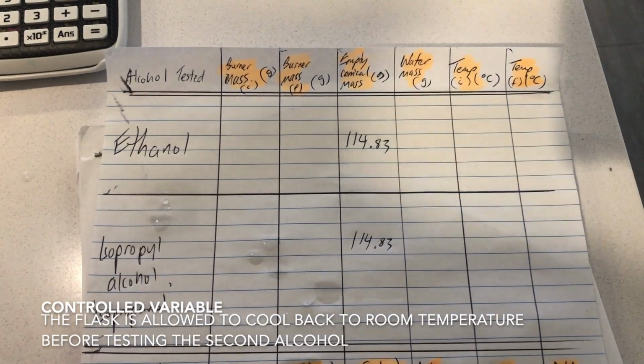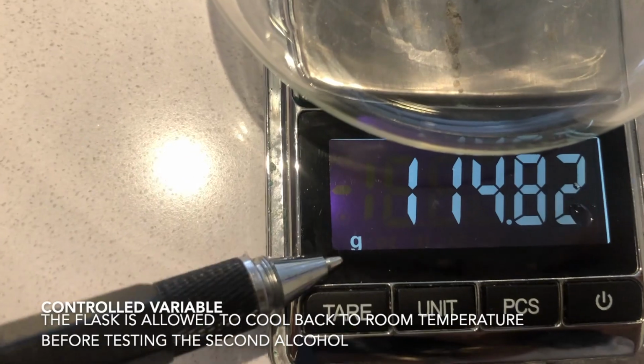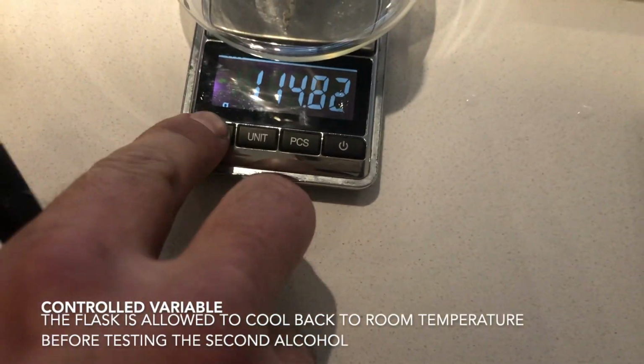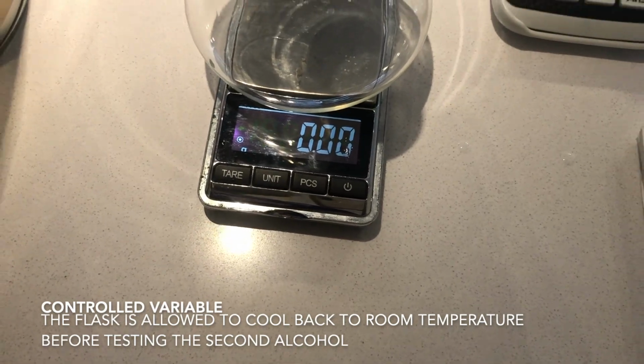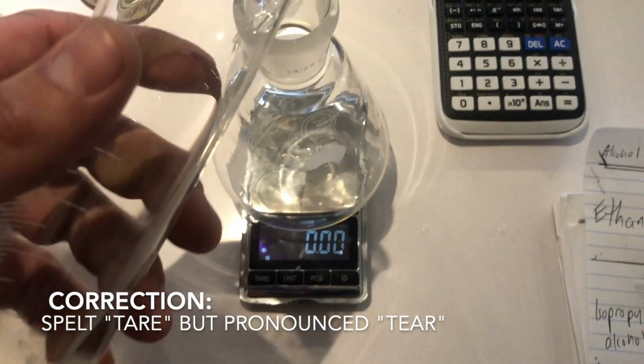Double check always on your scale, so you should always see a unit. Sometimes those units can be changed into things like ounces, so always make sure you're right. All right, so we're going to tare it, and we're going to pour in an amount of water that will try to be consistent for both experiments.